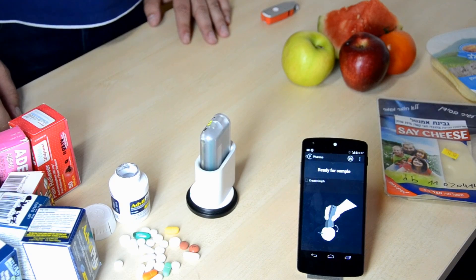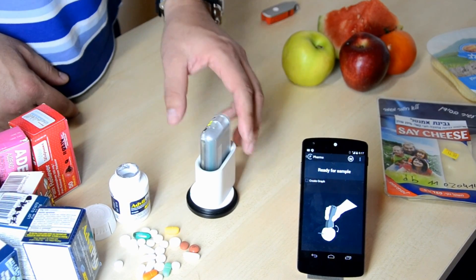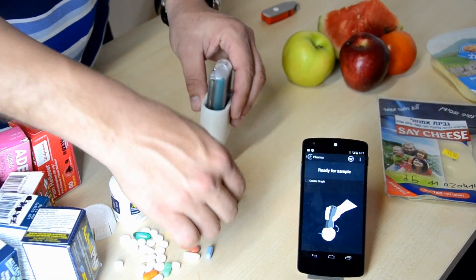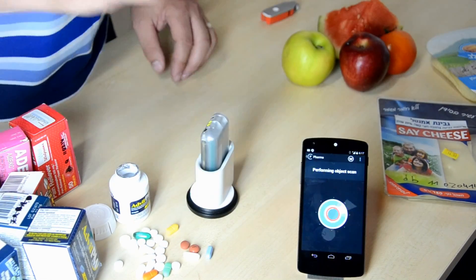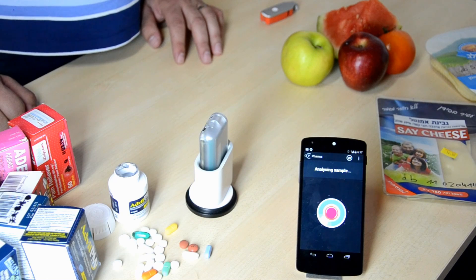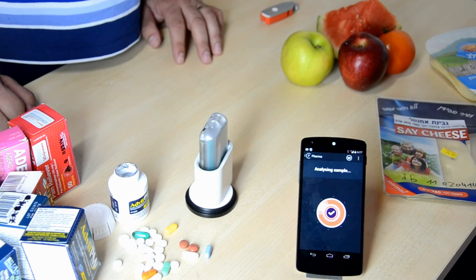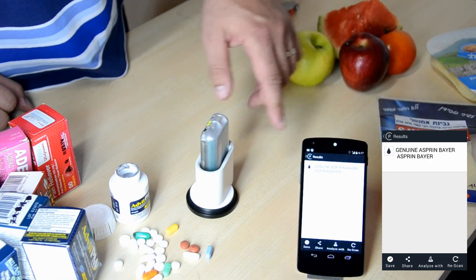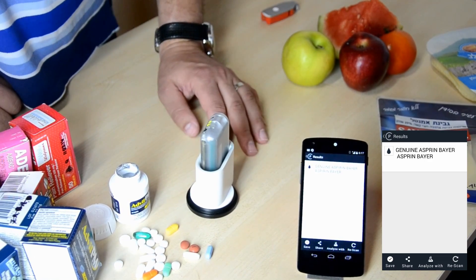Next, let's take a random pill and use our device to identify it. We wait a couple of seconds and should see the result on the screen. It was identified as Aspirin. This is our current prototype and we are now ready to move into the fabrication of our first product.